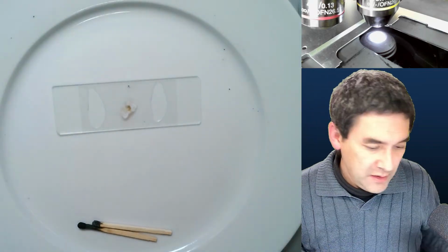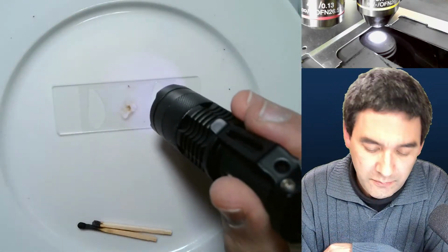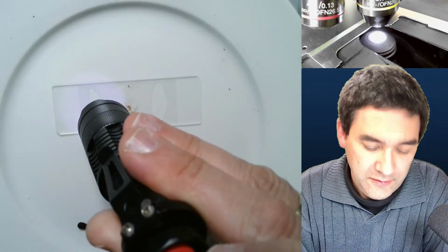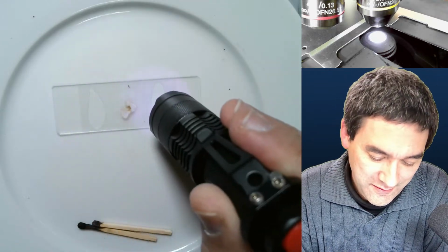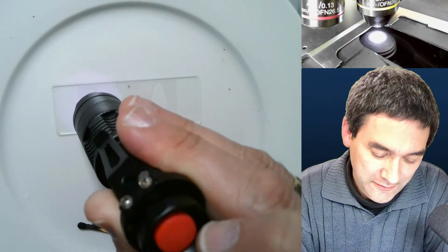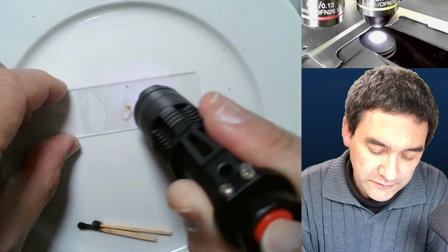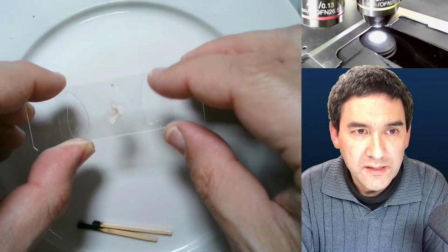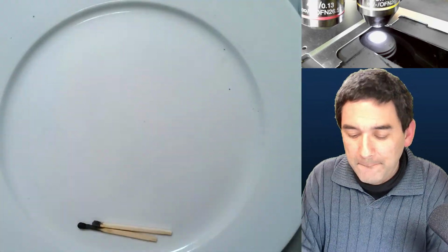And then, of course, I need my flashlight, the ultraviolet flashlight. Yeah, I treat it for approximately 30 seconds or a minute, depending a little bit on the intensity. And then I have basically my semi-permanent slide of those crystals. Okay. Because those crystals, obviously, if you touch them, they will come off. I'm just going to leave it at this. Maybe this is already enough. Yeah, the cover glass cannot be moved anymore. Of course, I'm able to peel it off with force, but you can always do that.